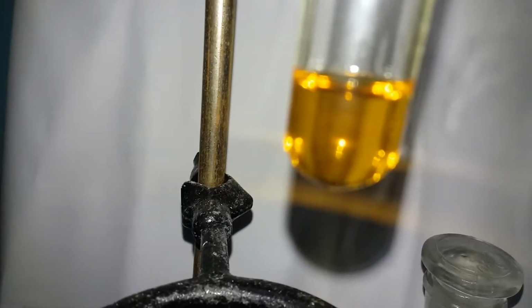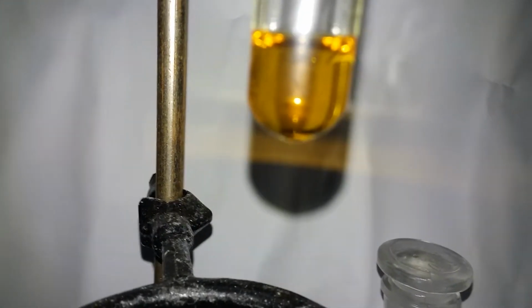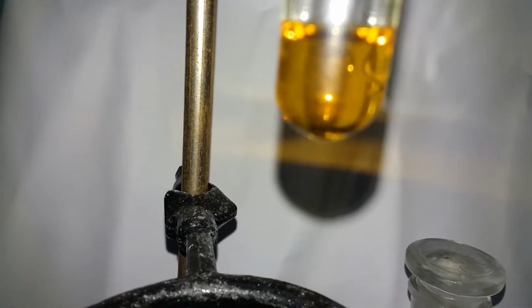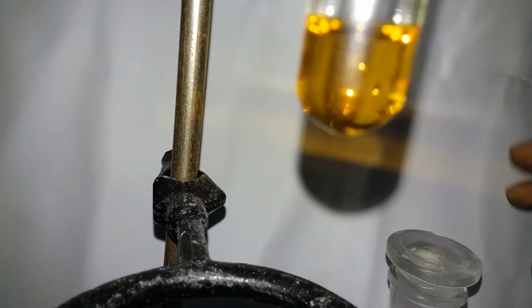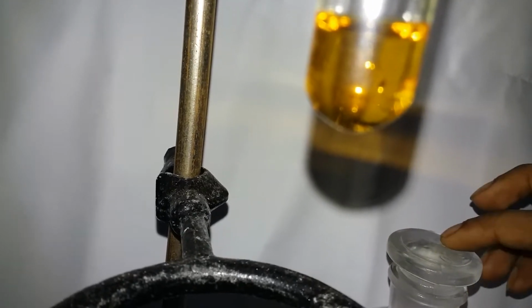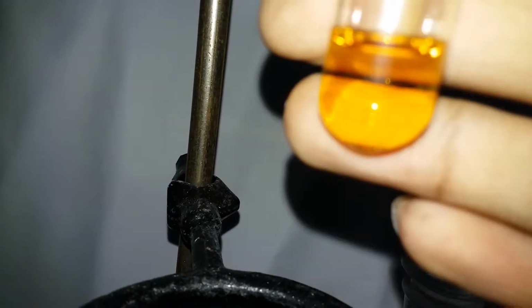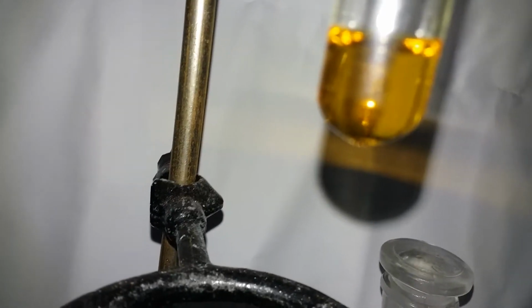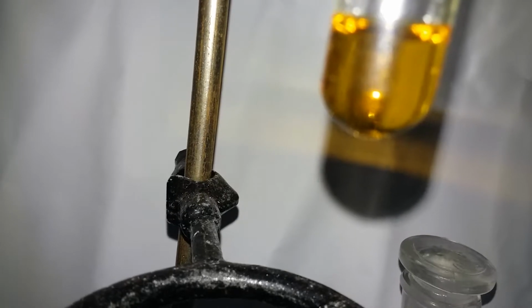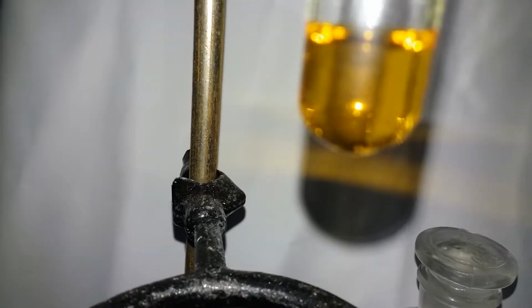Well, so here we have some iodine suspended, or well, we don't have anything. We just have hydroiodic solution and potassium sulfate solution. So what happens if you add concentrated 98% sulfuric acid? What happens is iodine directly comes out of the solution and I can feel it, it's exothermic, and this reaction is also exothermic, the adding 98% sulfuric acid. So it directly precipitates out, so you don't need to add hydrogen peroxide.